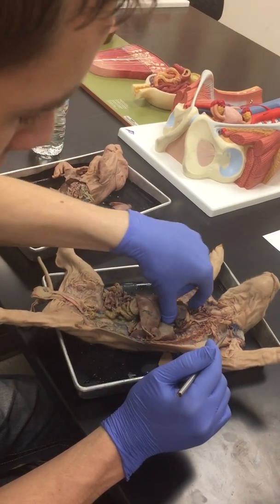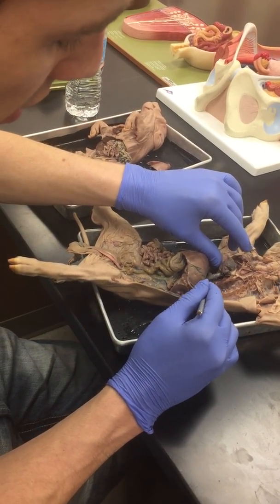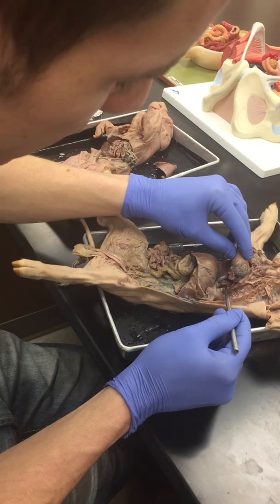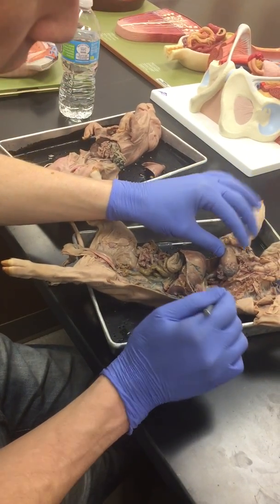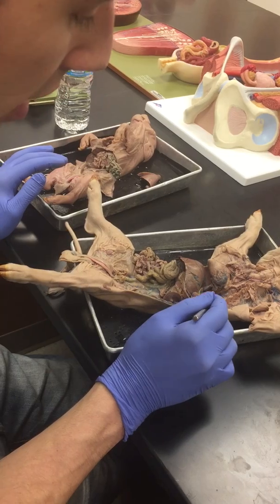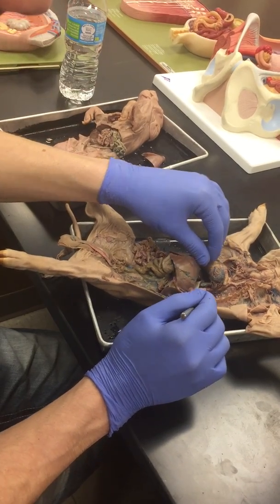Looking at the bottom of the heart, you're going to have the inferior vena cava, which is right here. And then you've got 3 tubes underneath here. Inferior vena cava. This one is the esophagus, which is more musculature, more smooth muscle. And then this vessel here, really thick, especially since we filled it with latex, is the descending aorta, since we're still in the thoracic cavity. So pretty much the aorta going down there.